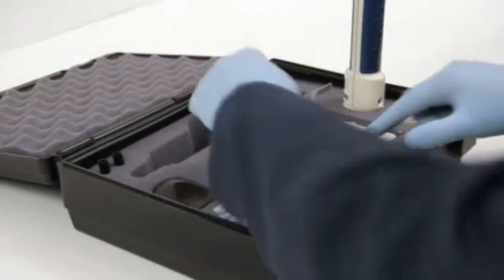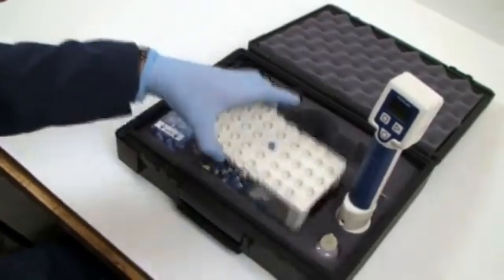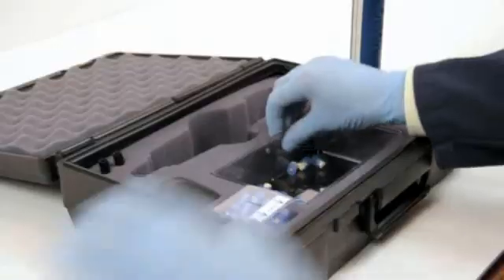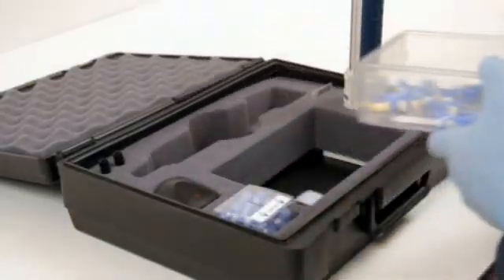Okay, we're out of nibs. Simply eject the top, and then you can easily dispose of all the old nibs.